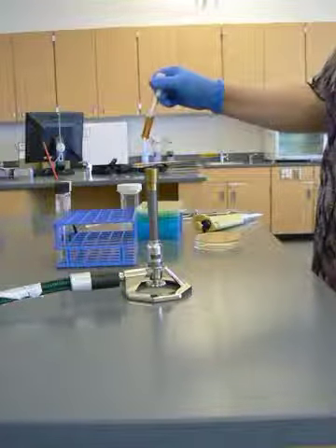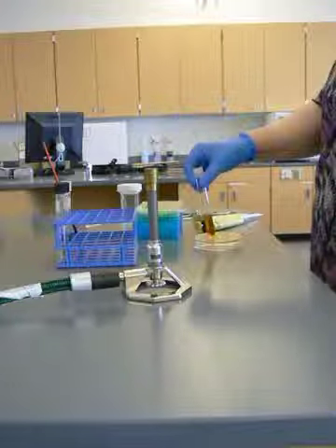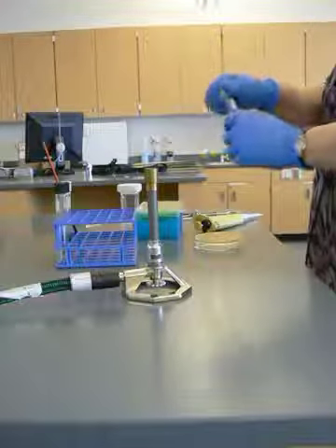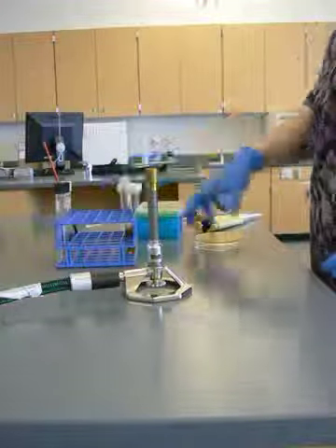I've got what I'm going to add to my plate. I've got my microbes in here. I'm going to loosen my lid, and I have my plate.